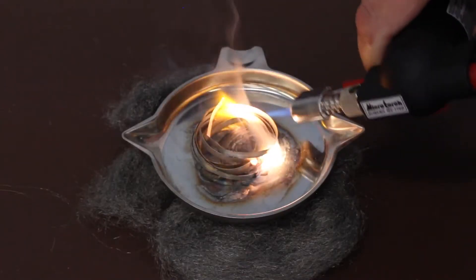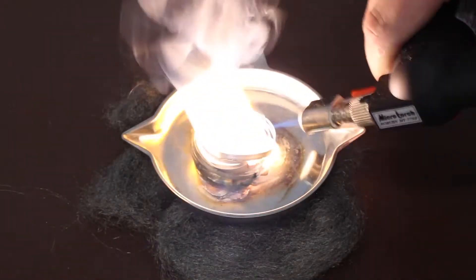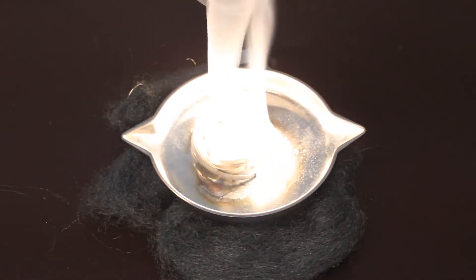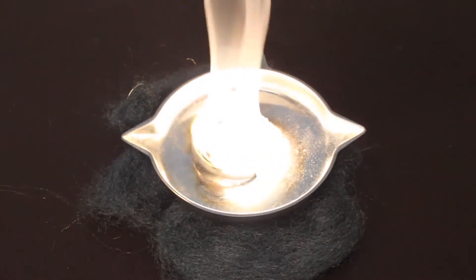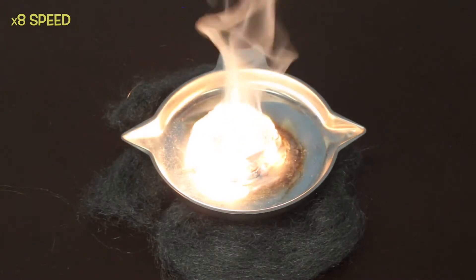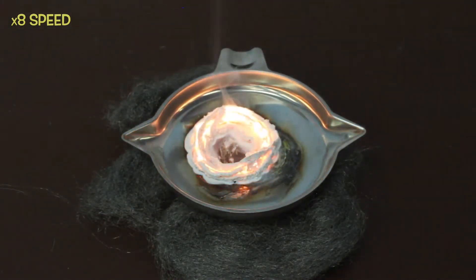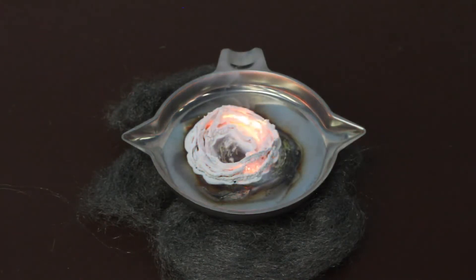Similarly, a strip of magnesium will go through the same process, but at a much quicker rate. A large amount of the energy produced is released as incredibly bright light, even emitting high-energy ultraviolet light in the process. But the result is the same as before — an oxidized strip of magnesium.